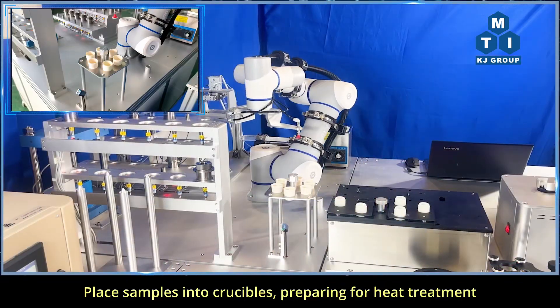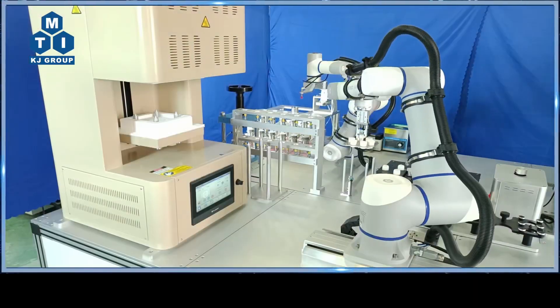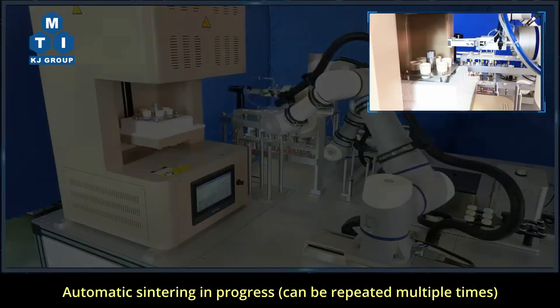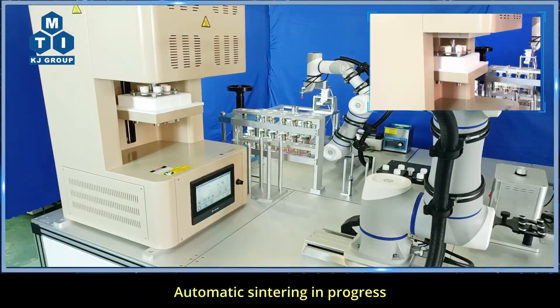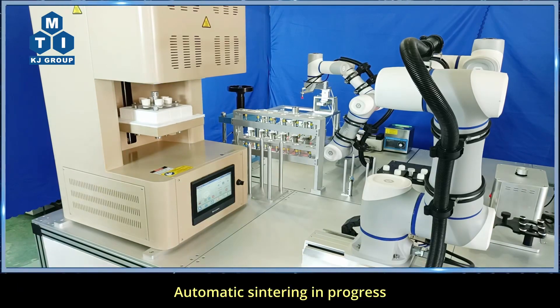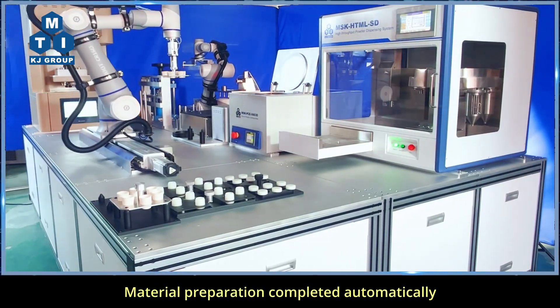Place samples into crucibles, preparing for heat treatment. Automatic sintering in progress, can be repeated multiple times. Material preparation completed automatically.